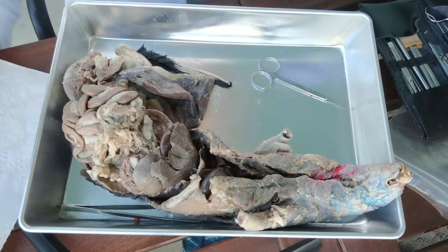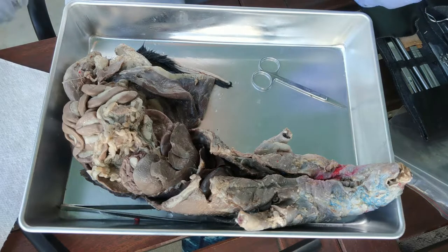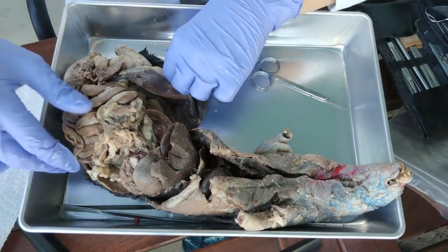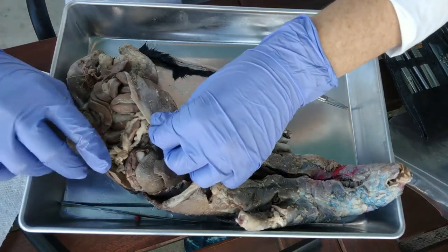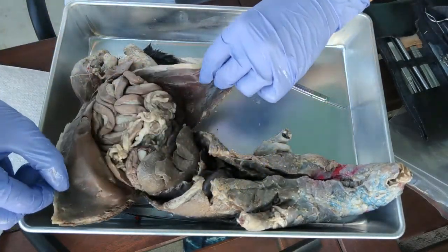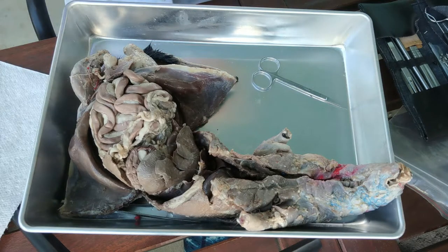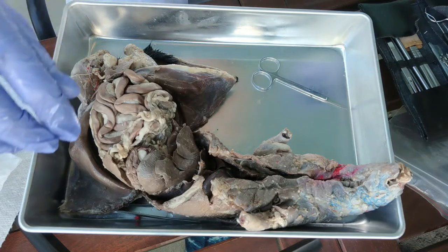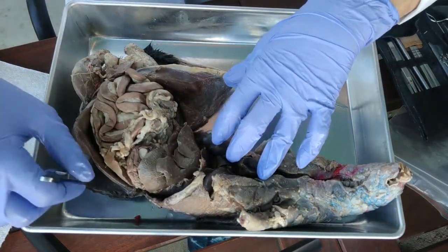Hello everyone, this is Professor Roth and today we're doing the digestive system. The first thing you'll notice is I have already opened my ventral cavity — that is covered in a separate video, so if you haven't watched that, you may want to go back and do so. Now we're going to look through the organs of the digestive system.